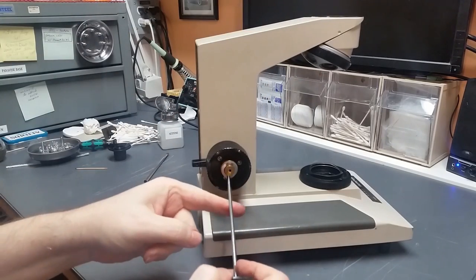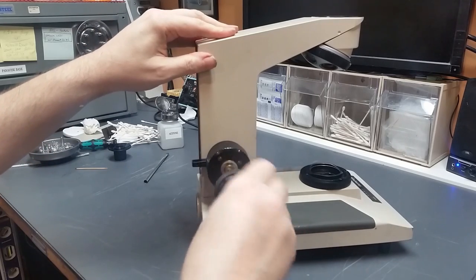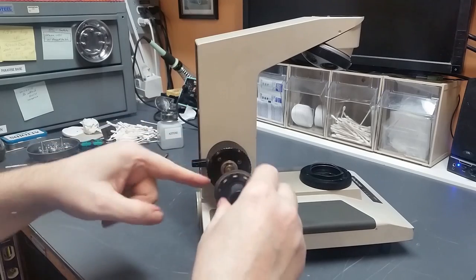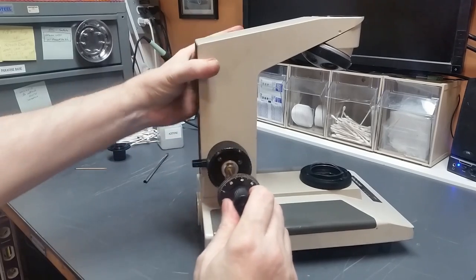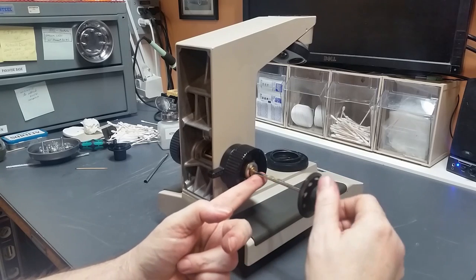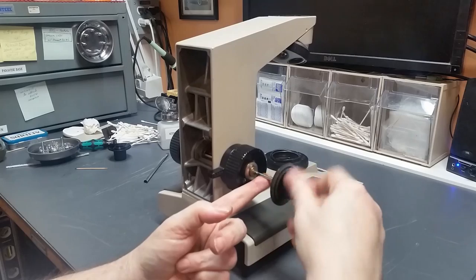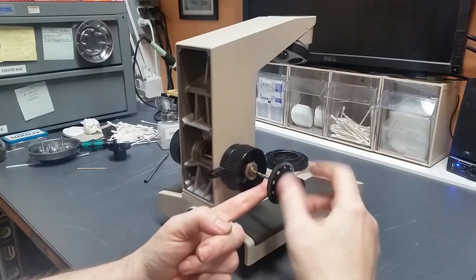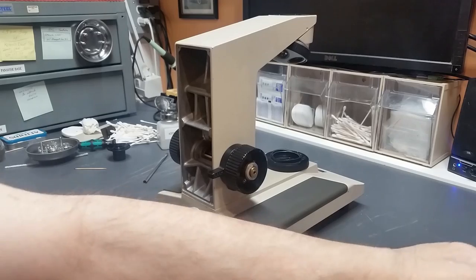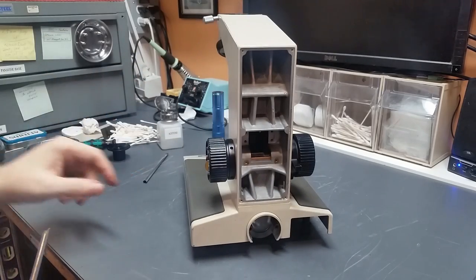And as you can see, the grease shot out, which is, I guess, to be expected. So we'll do the same thing on this side. Distribute that grease as much as we can. This grease here, let's make sure that it also covers the whole surface of the shaft. Okay, so there's plenty of grease there. The thing's not going to be starved for grease. Now, come over here on this side.